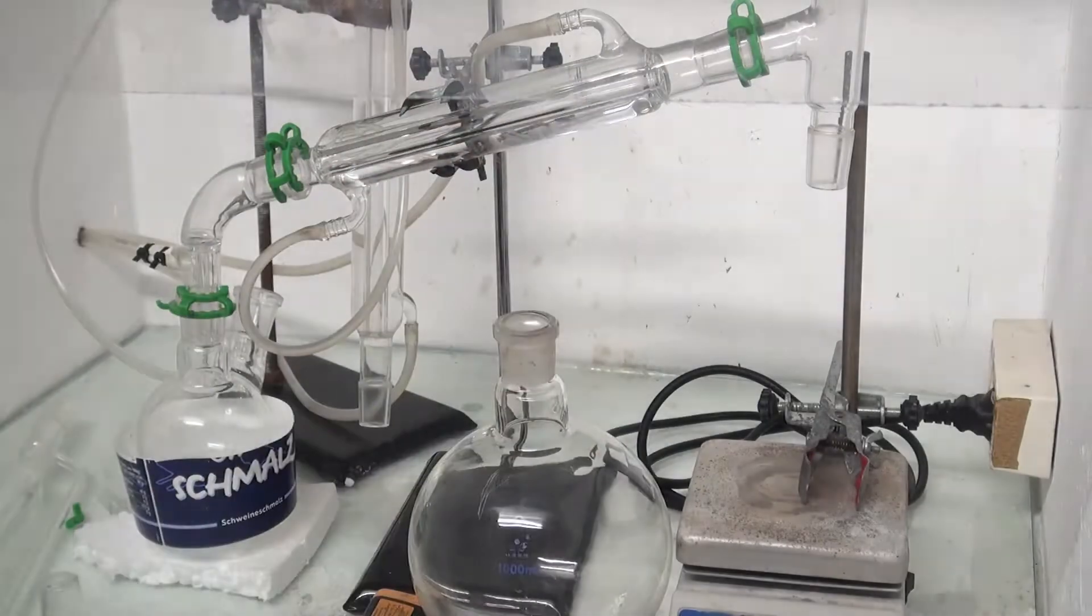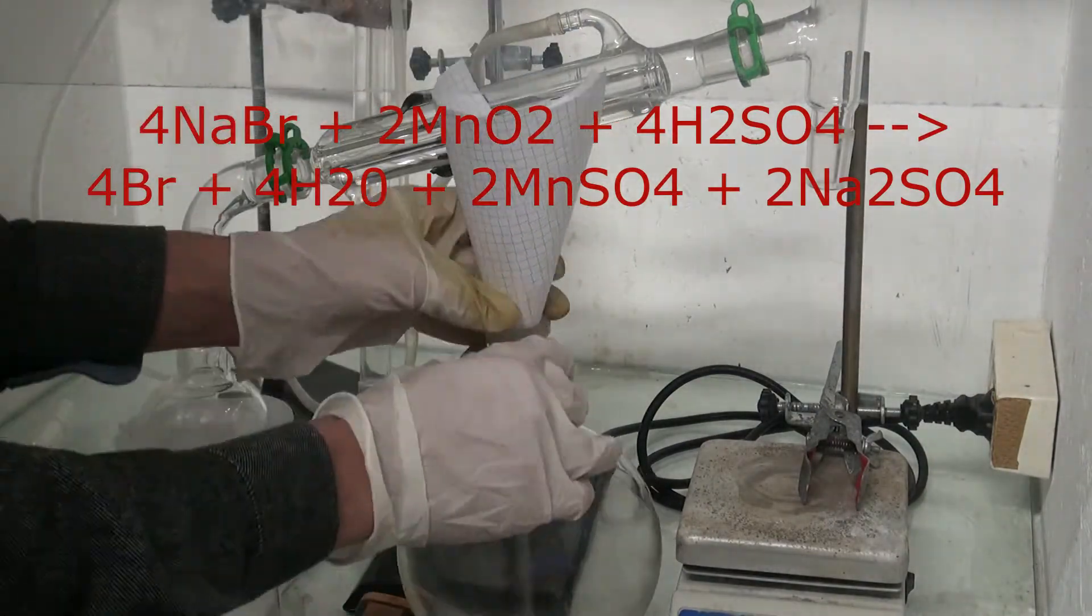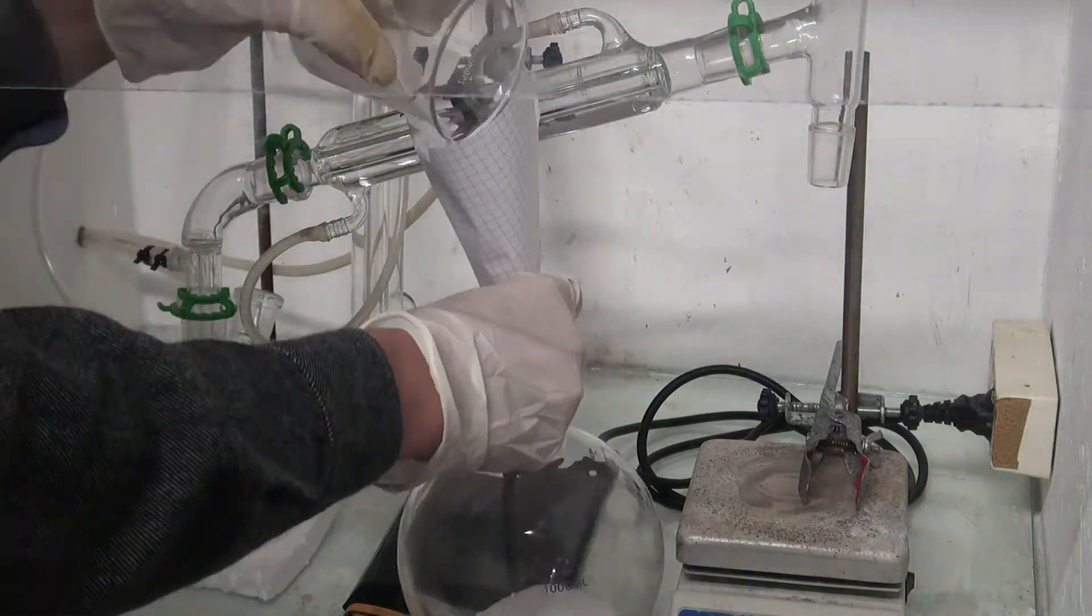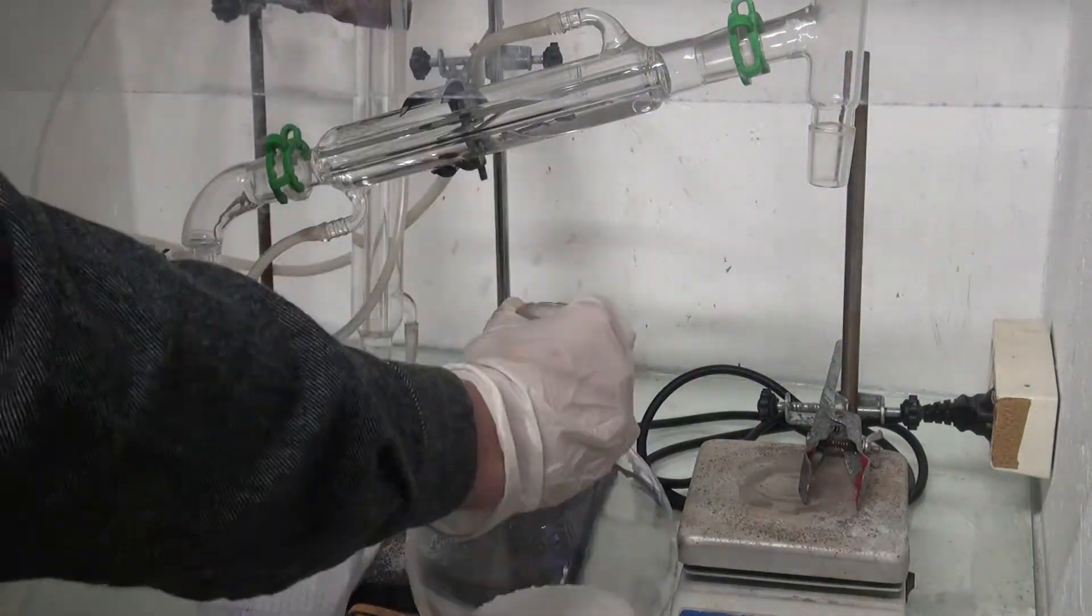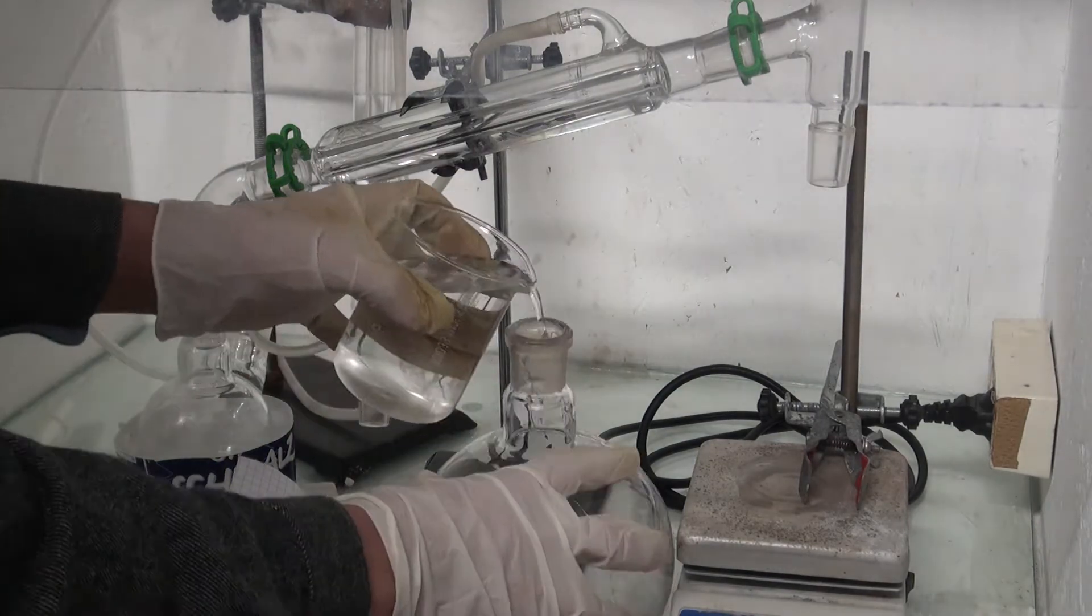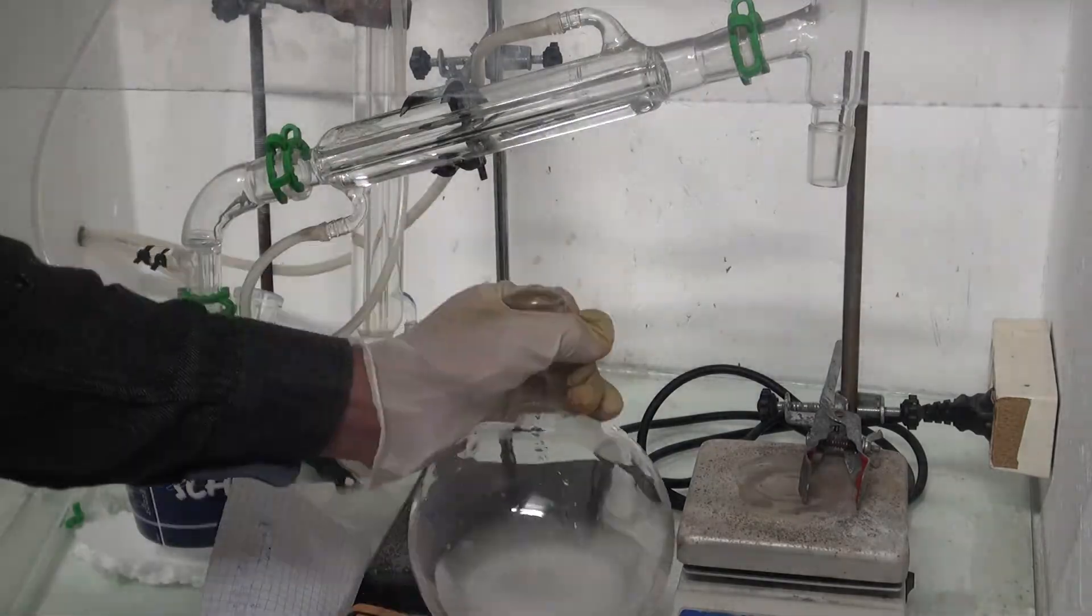A way that gives a much better yield is by performing those two reactions in one. I started by adding 2 moles of sodium bromide and then 1.2 moles of manganese dioxide into a flask and then dissolving the sodium bromide in water.